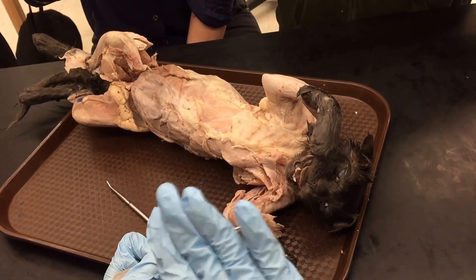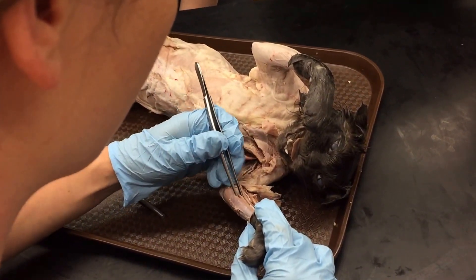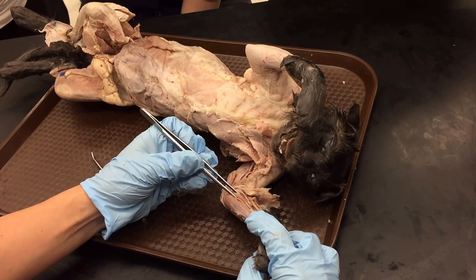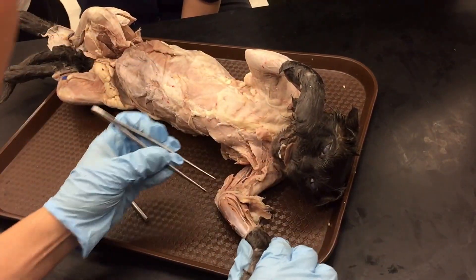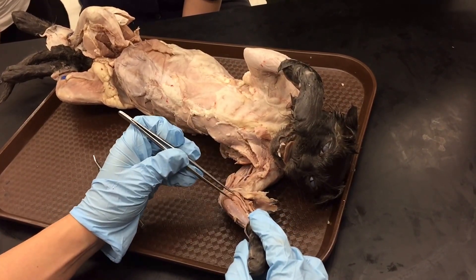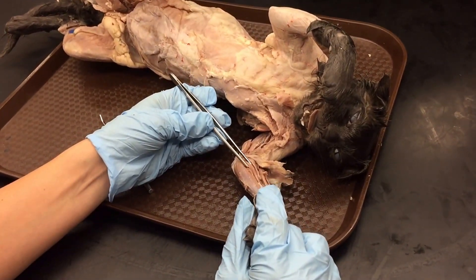If you find that, you'll be okay finding the others. There are four muscles, with palmaris longus as one. Up from there is the flexor carpi radialis towards the radial side of the arm, and then the pronator teres, which on most specimens looks like a triangle starting from the elbow joint and typically gets smaller along the arm. So for memorization: pronator teres, triangle-shaped.